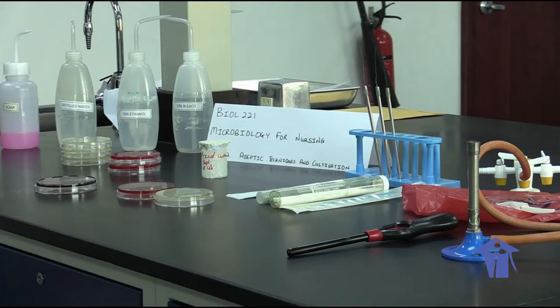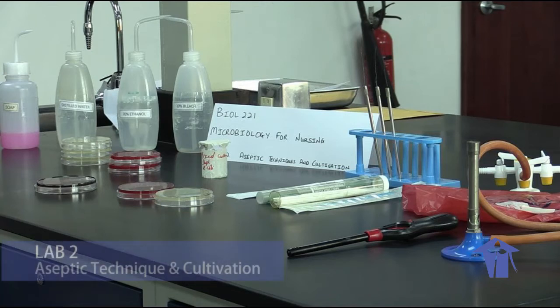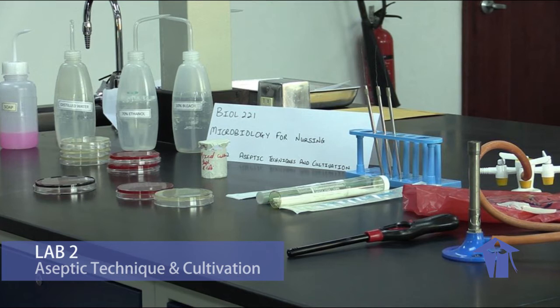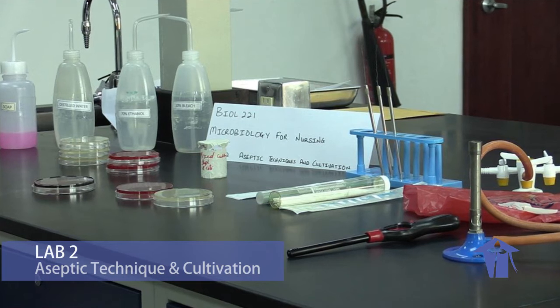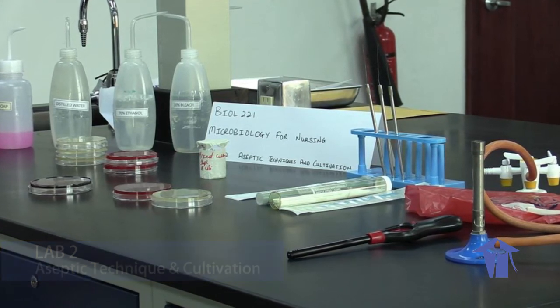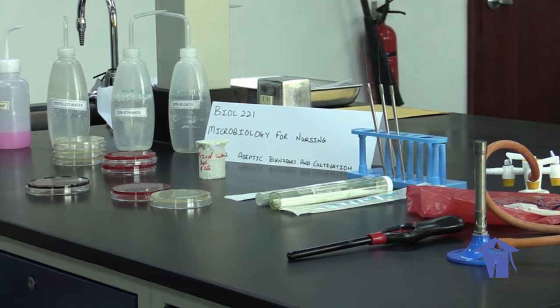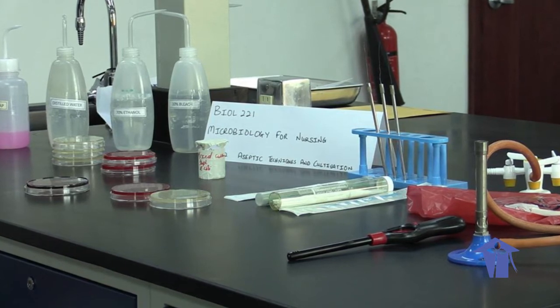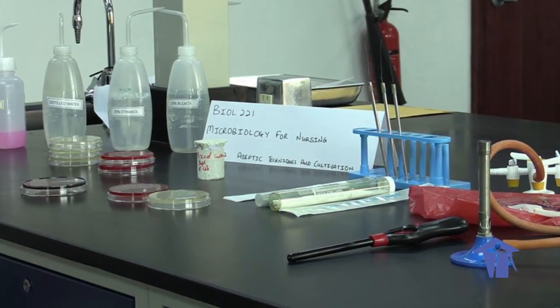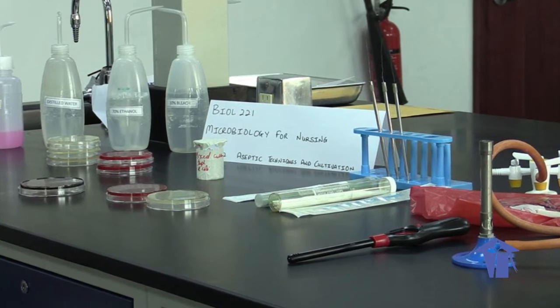Good day Bio 221. Welcome to Lab 2, our session on aseptic technique and cultivation. In today's session, we're going to look at identifying types of media and ways in which we can isolate bacteria using aseptic technique.